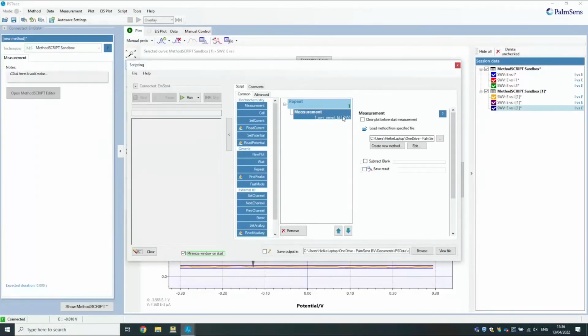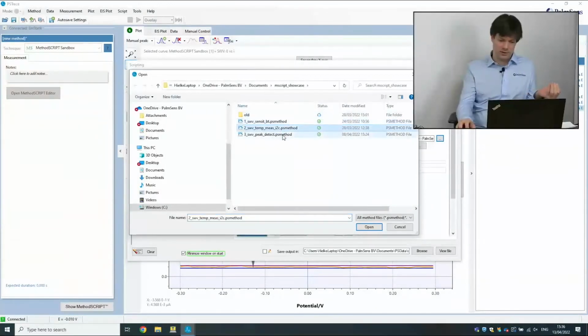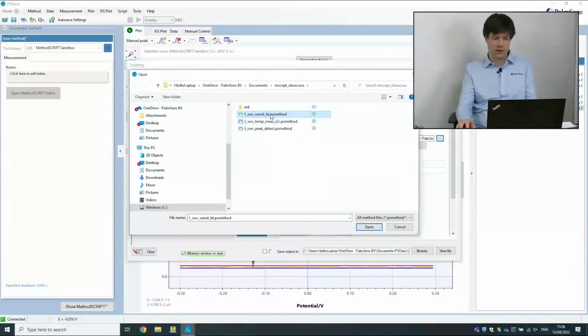Yes. When he had opened the measurement blocks and he was loading a method file for this, he was actually loading the same file that he used to save his MethodSCRIPT files. So you could make a custom method file. Maybe you can show that as well, if it's possible. It just means the following: you can fill this measurement block with anything you like. Exactly. I've made these 3 measurements that we've used during the demo, and I can just load any one of them.